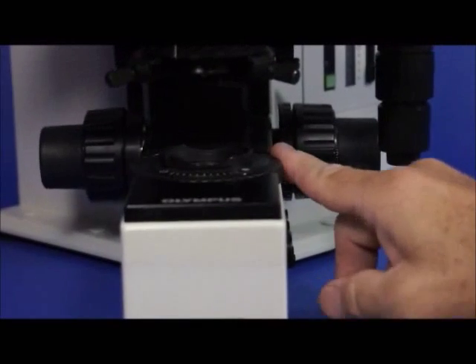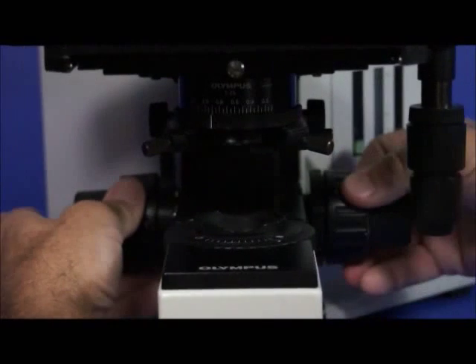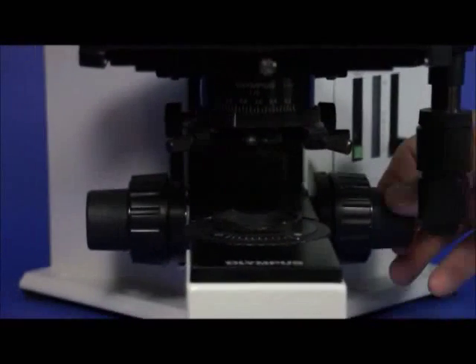We have coaxial coarse focus, one on each side of the microscope. The big knobs are for coarse focus. The smaller knob is for fine focus.